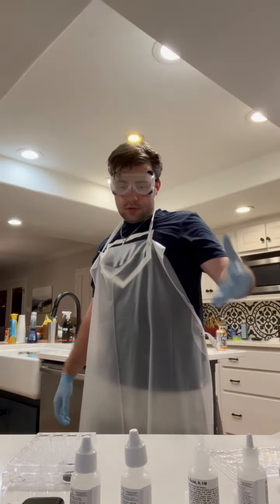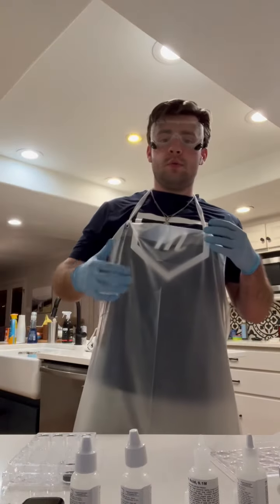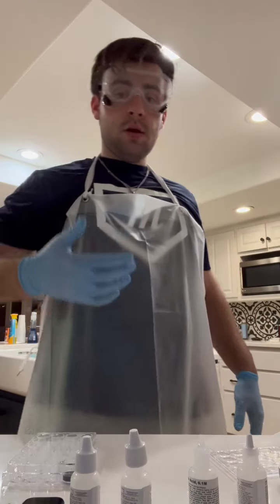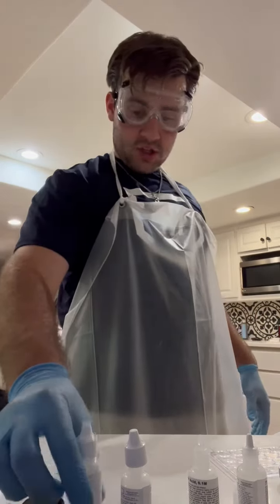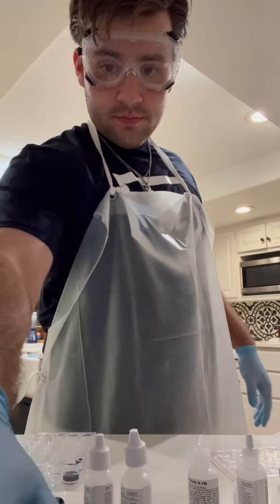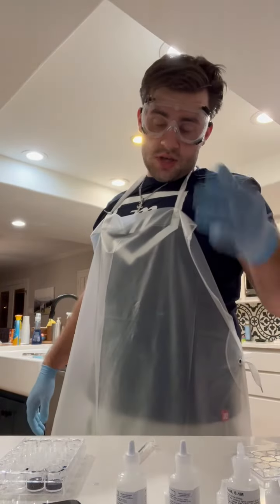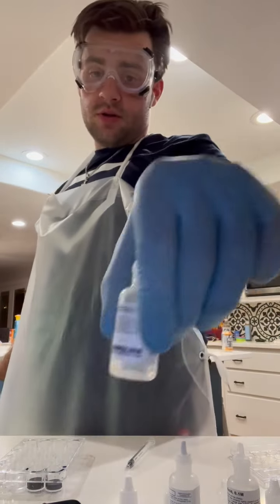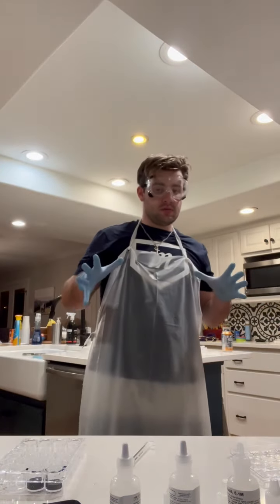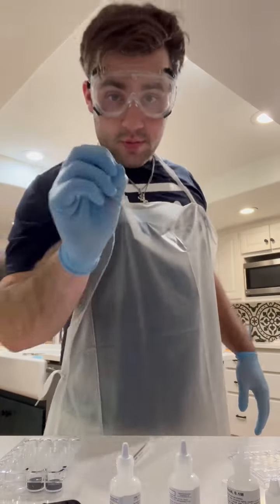Now that I've done this mixture, it took 23 seconds, therefore it wasn't in the interval of 18 to 22 seconds, so I need to do it again, but this time with 1 less drop of the sodium thiosulfate. Now that I've learned that it takes 7 drops of sodium thiosulfate to get it in between the 18 to 22 second range of color change, I'm going to go on to activity number 2.